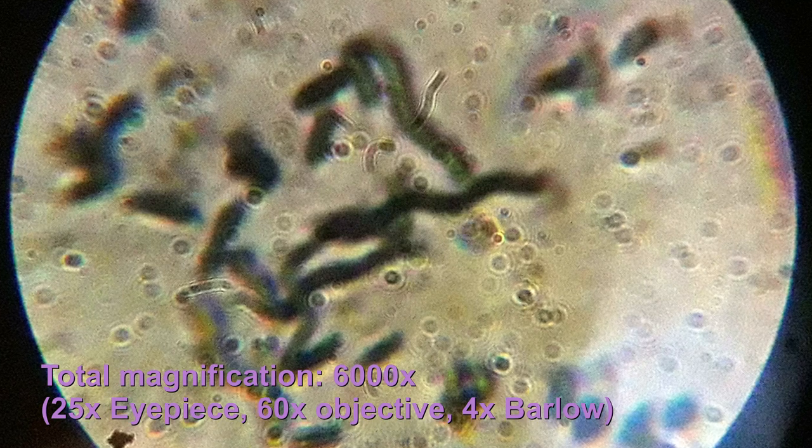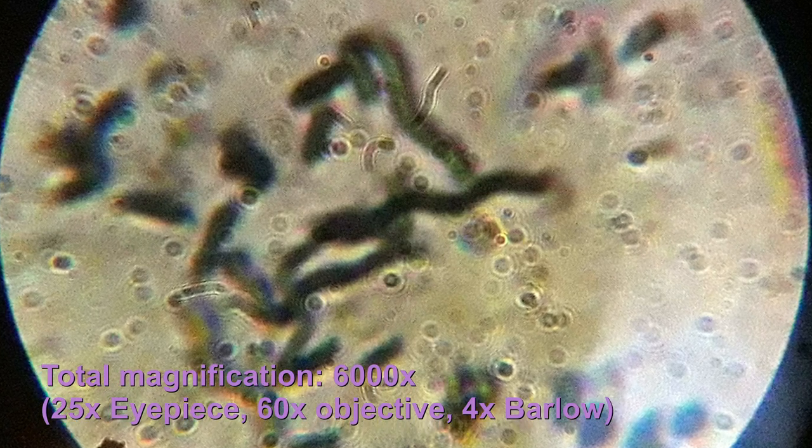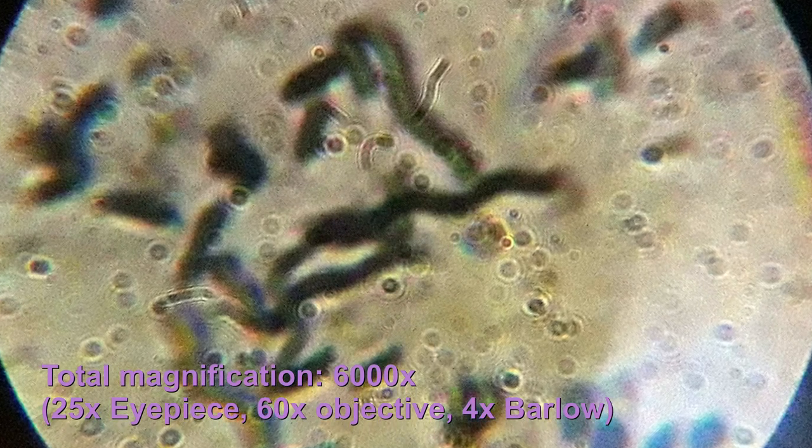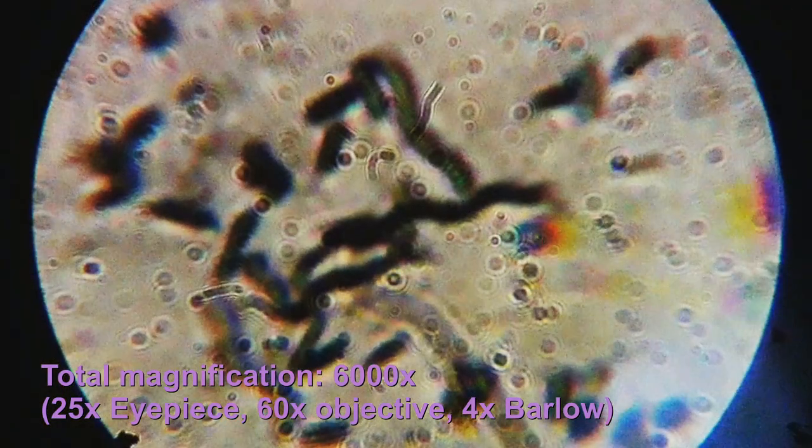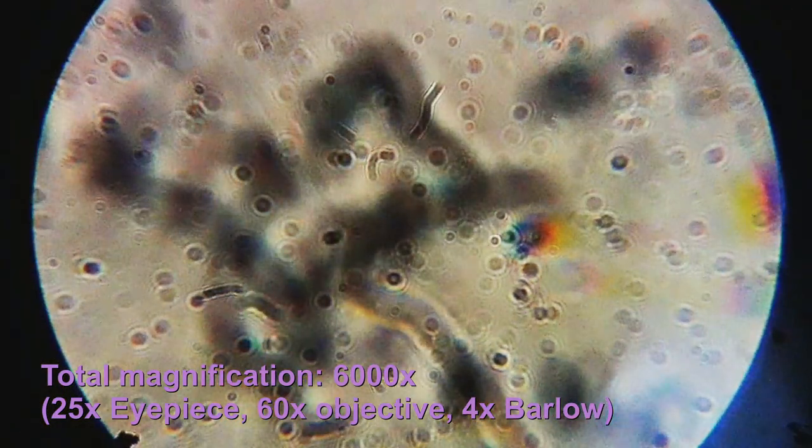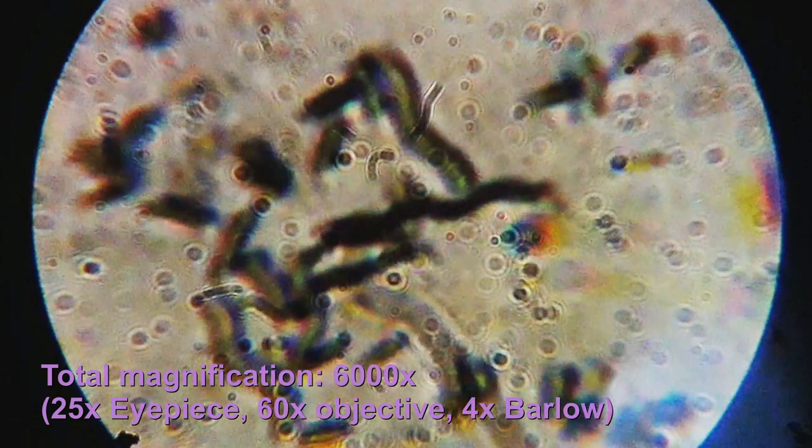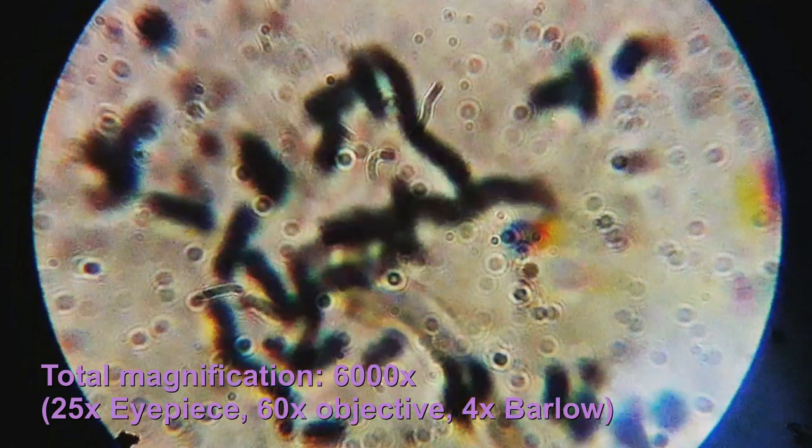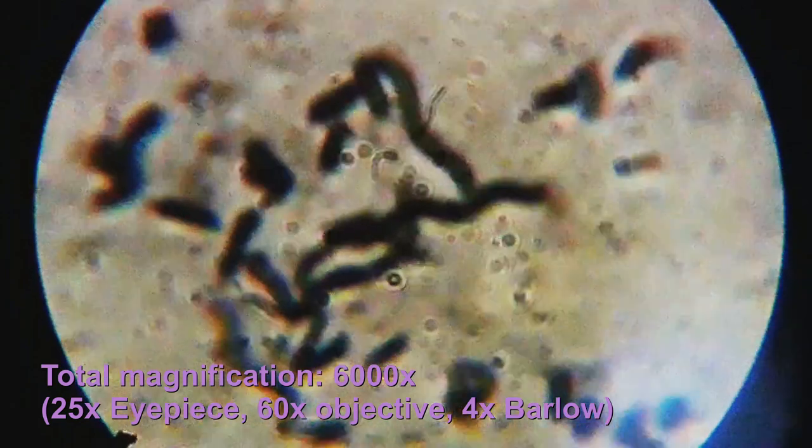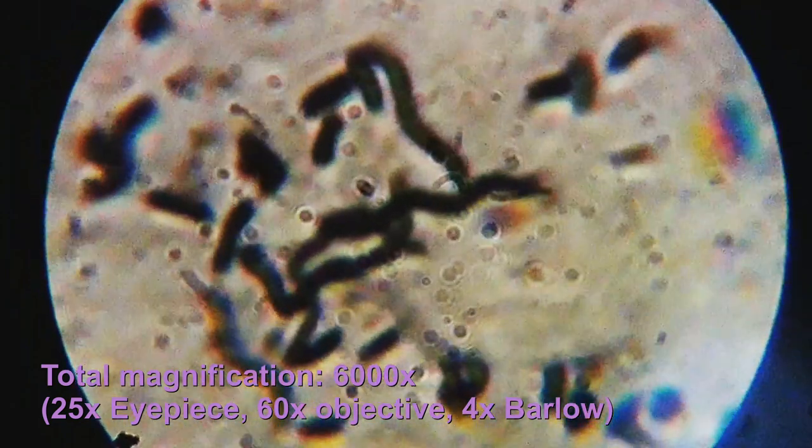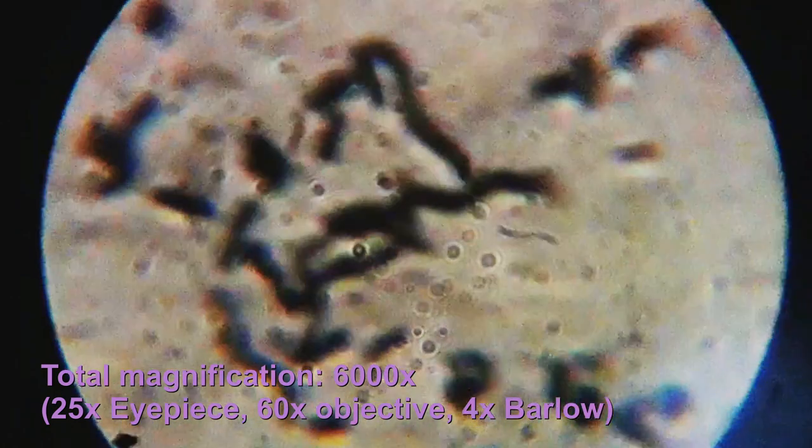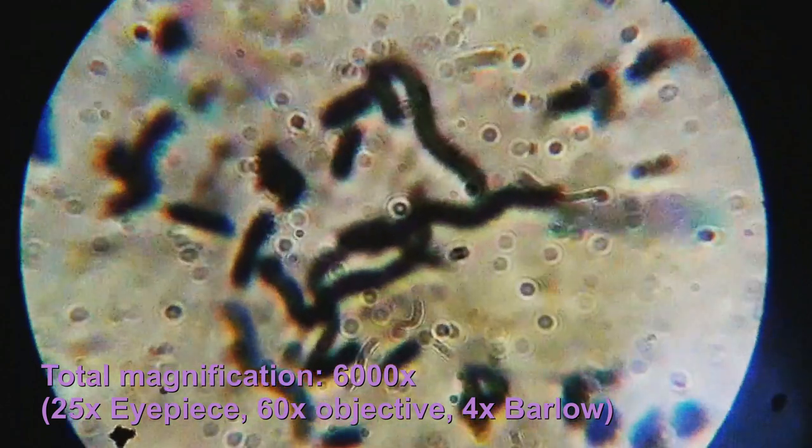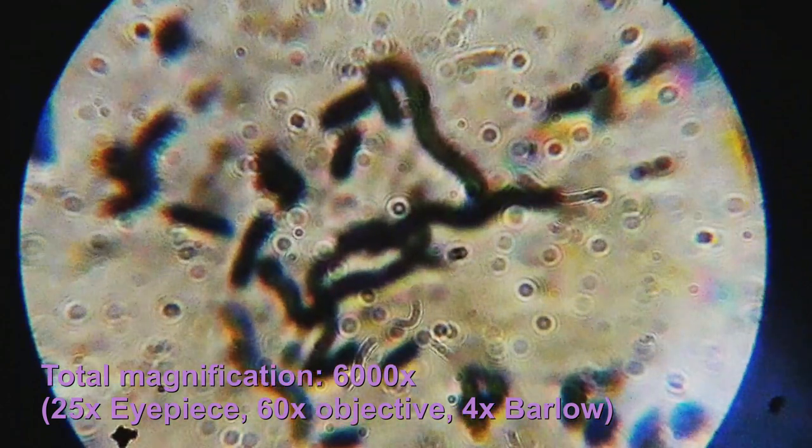The zoom you see now is a digital zoom that I did with my video editing program. I wanted to check the location of the dirt so I'm focusing back and forth. The dirt stays in focus so this means it's not on the specimen slide itself but somewhere else. Now I'm rotating the system and the dust must be either on the Barlow optics or on the eyepiece because it's rotating as I turn the whole system.